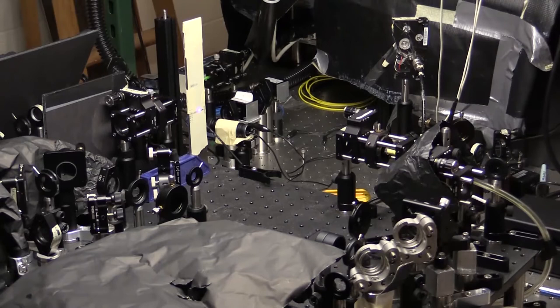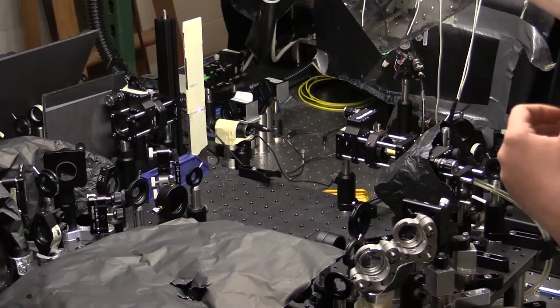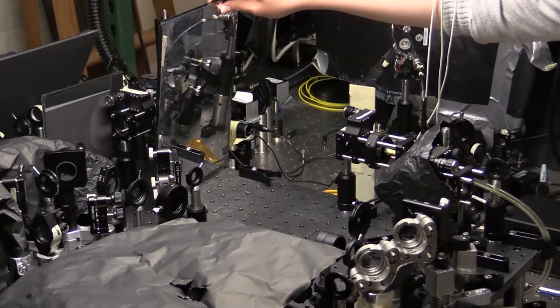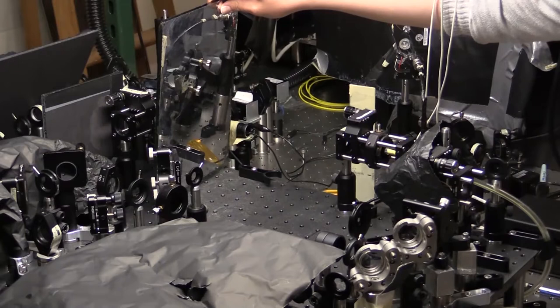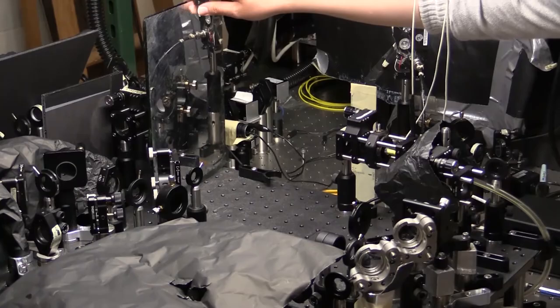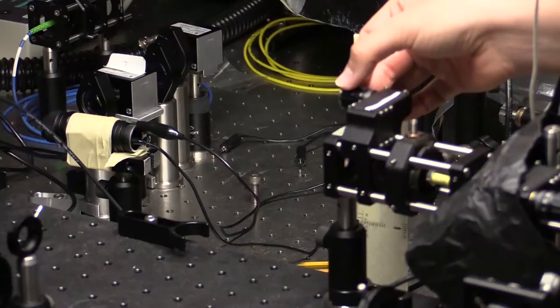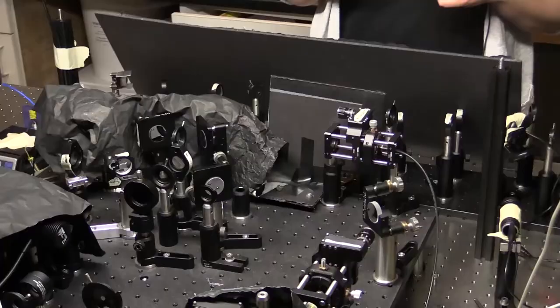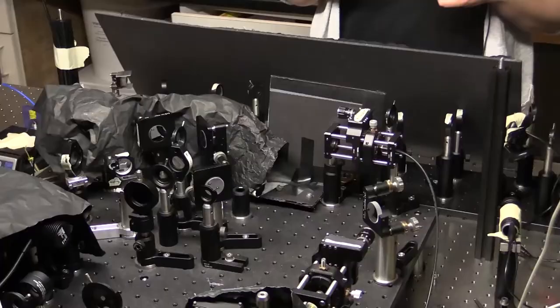You want to make sure that it's collimated over a distance that's very long compared to your entire system. So right now this isn't quite far enough away. Typically, I would use an old mirror like this to send the beam somewhere to infinity. It's important when you place the mirror in that you always tilt it down first before you know where the beam is going, so as not to hit anyone in the eye. You can send it to infinity and have your friend go far away and make sure that the beam is still the same size it was at the entrance pupil. In order to adjust the collimation you'll rotate a knob like this — it changes the location of the lens.